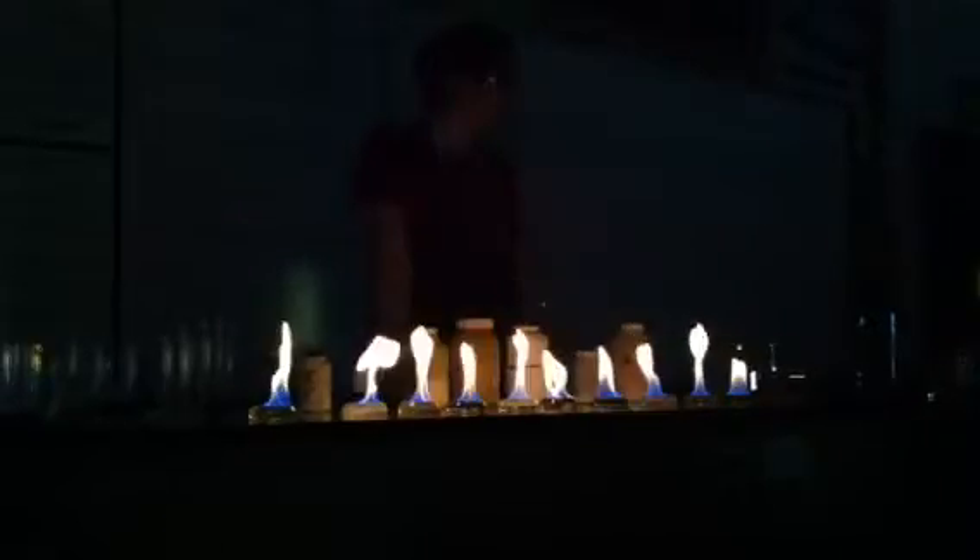Can you just put salt on a fire and then... This is salt in a heat source, that's what it is. I have different kinds of salts. Look at that — very clear red here. Some orange with sparks. Pretty clear greens. Some distinct yellow tones here. Some sparkles and oranges. More orange-ish red. Green is here.